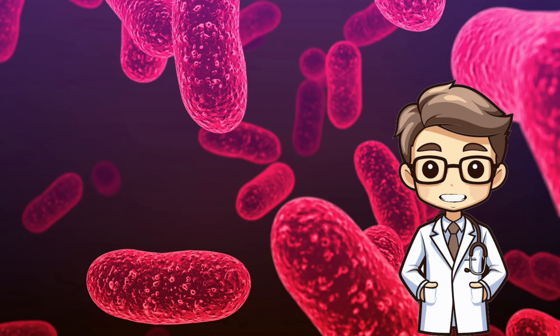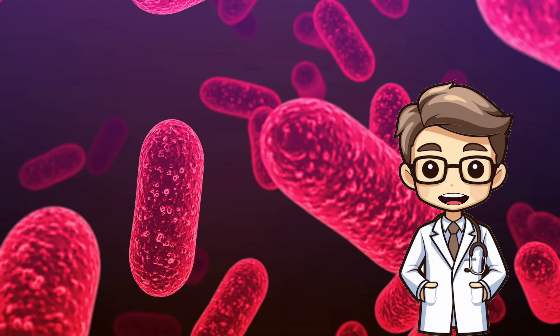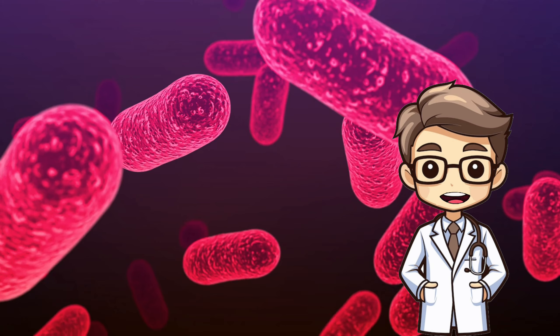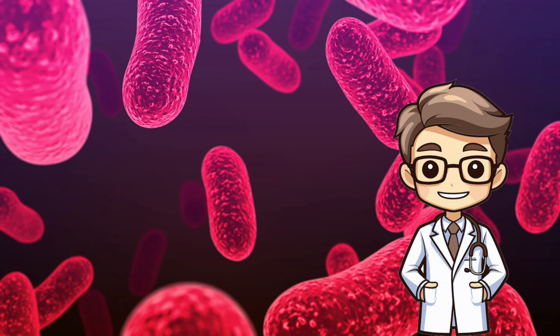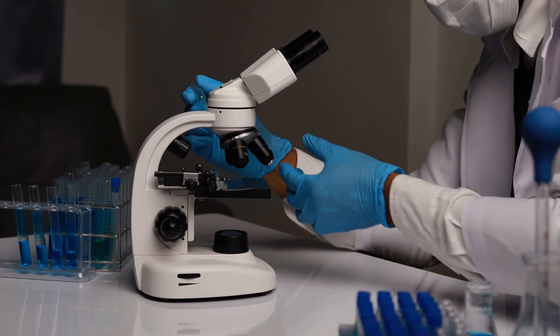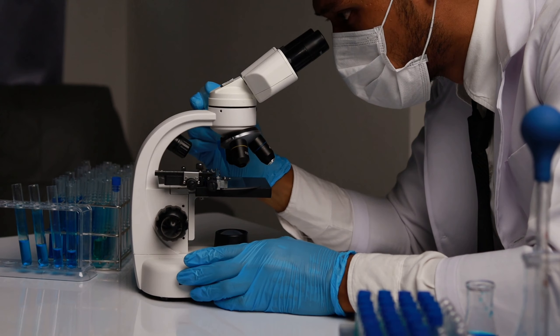He was the first to see and describe bacteria, yeast plants, the teeming life in a drop of water, and the circulation of blood corpuscles in capillaries. Over the centuries, the microscope has evolved into various types, each with its unique features and uses.